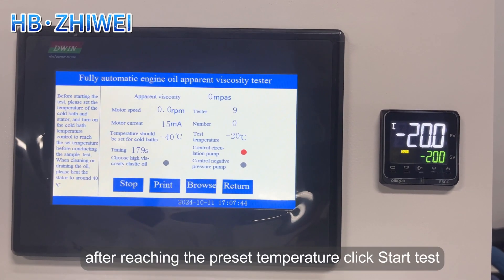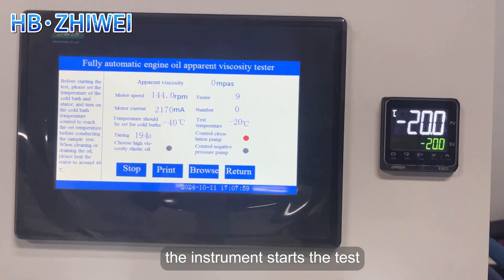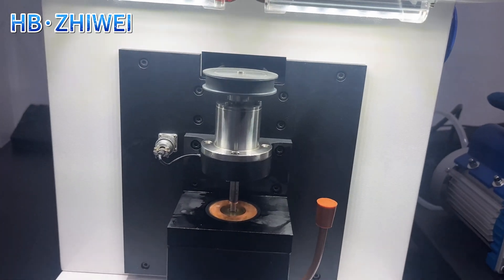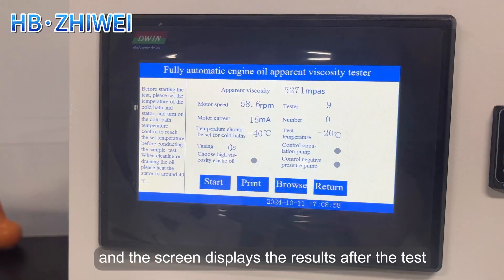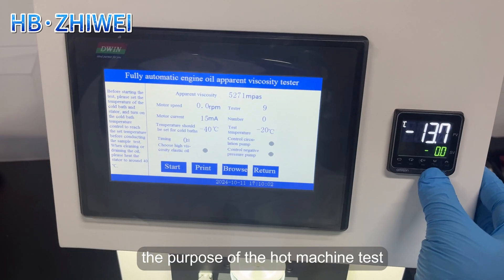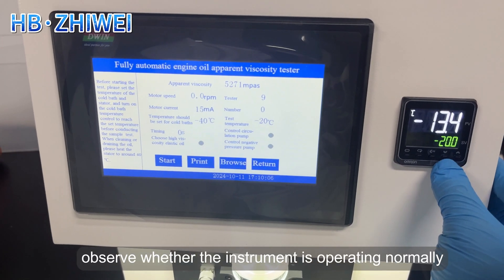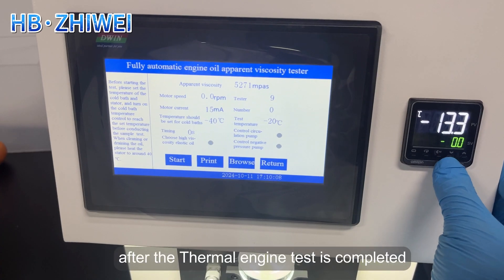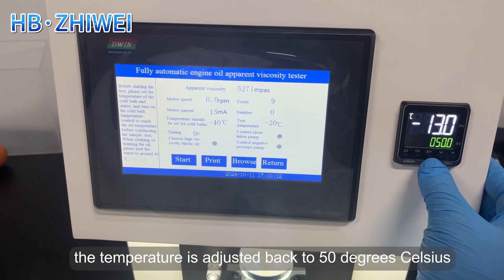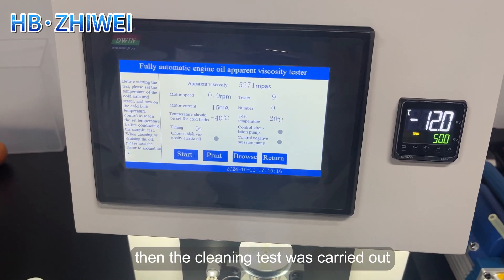After reaching the preset temperature, click Start Test. The instrument starts the test and the screen displays the results after the test. The purpose of the hot engine test is to observe whether the instrument is operating normally. After the hot engine test is completed, the temperature is adjusted back to 50 degrees Celsius, and then the cleaning test is carried out.